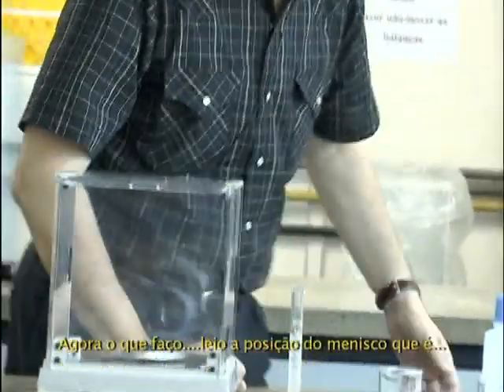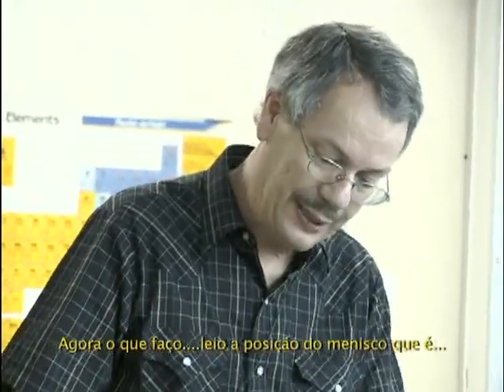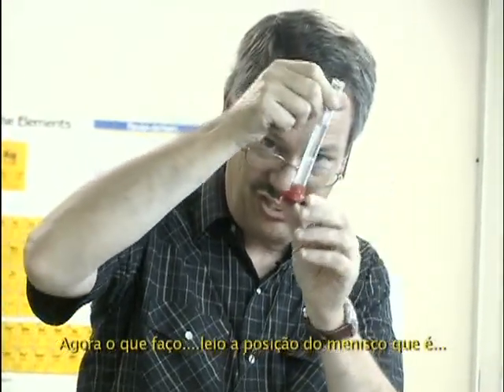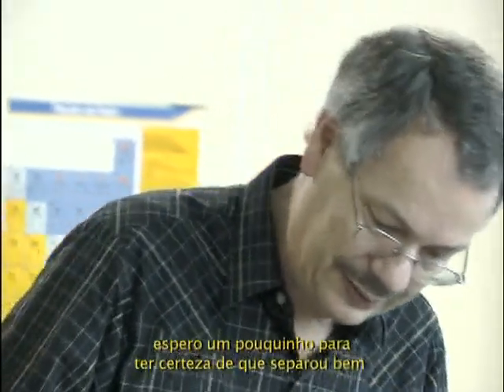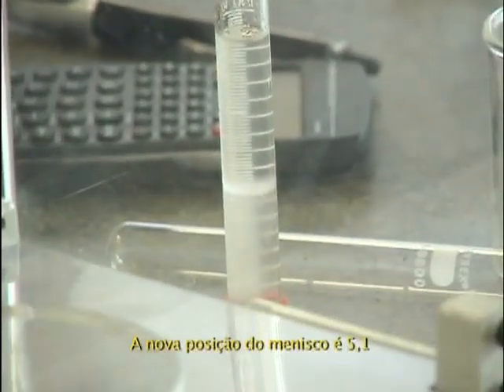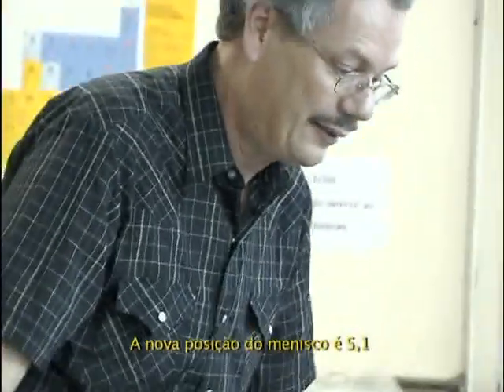Yeah, that's okay. Now, I read this meniscus position. I'll wait a little bit to be sure it's separated well. And now the new position of the meniscus is at 5.1.